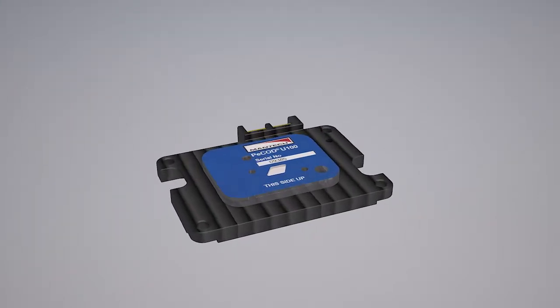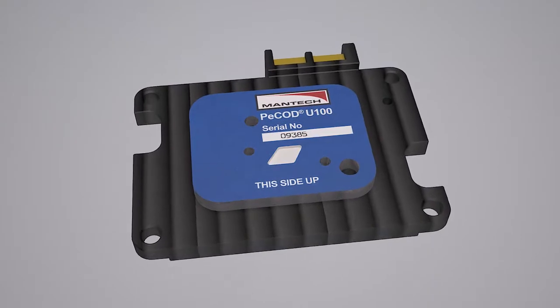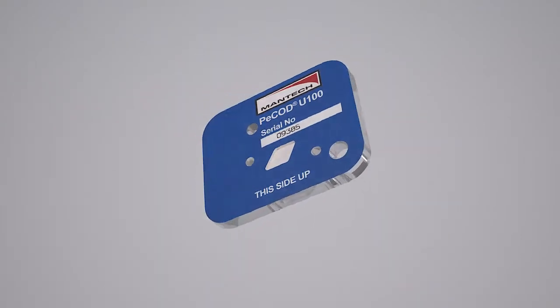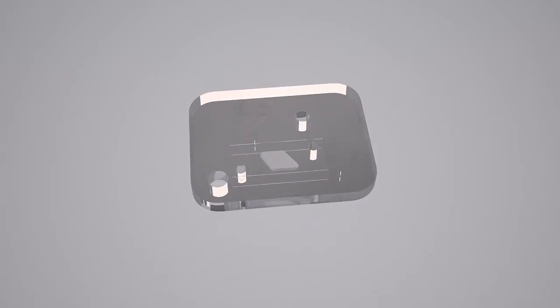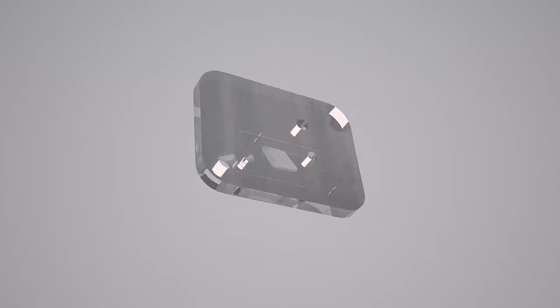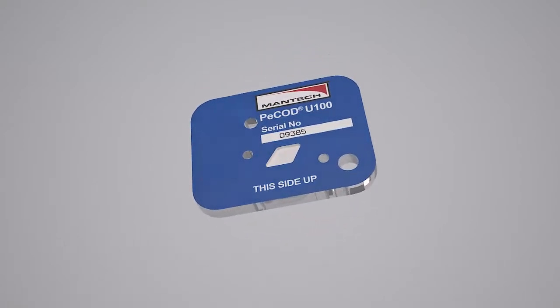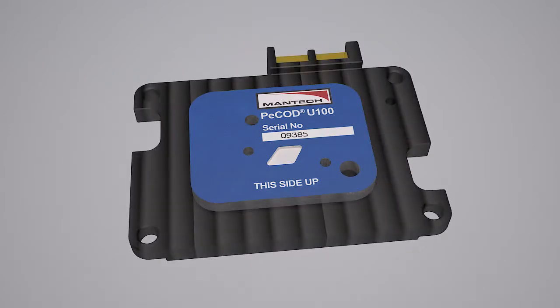The core of the technology is the UV-activated nanoparticulate titanium dioxide sensor coupled to the electrode block. The strong chemical potential of titanium dioxide makes it a very powerful oxidizing agent. The powerful oxidizing potential of the UV-activated nanoparticles ensures that virtually all species are fully oxidized, giving a true measure of COD.